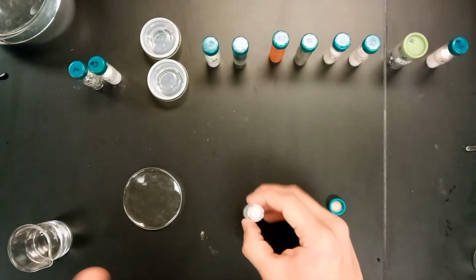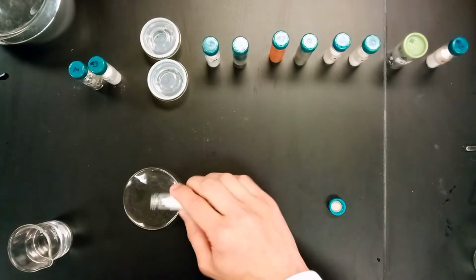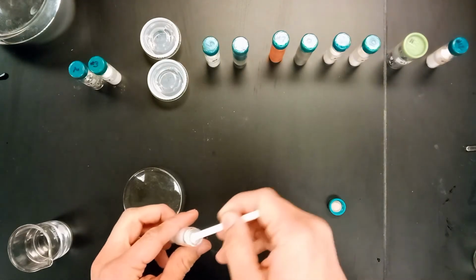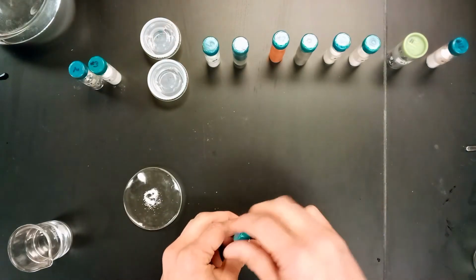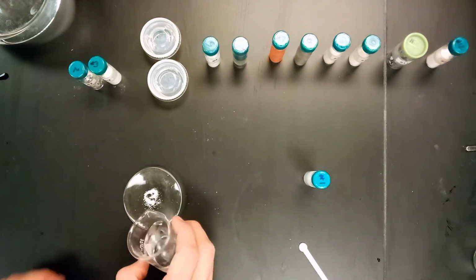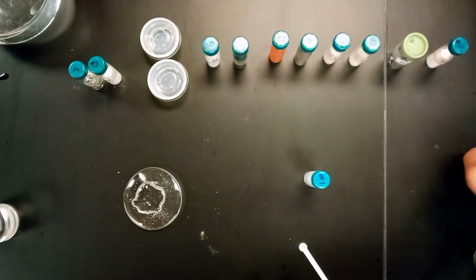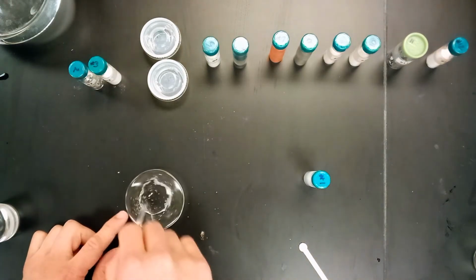So I guess there's two things we're really going to do to test this one. First thing is we're going to get just a small amount of it. If we can here, we're going to put a small amount of it onto our dish. And we're going to test the pH level by adding some of the water. There. See first off, of course, if it dissolves, which is the first step.